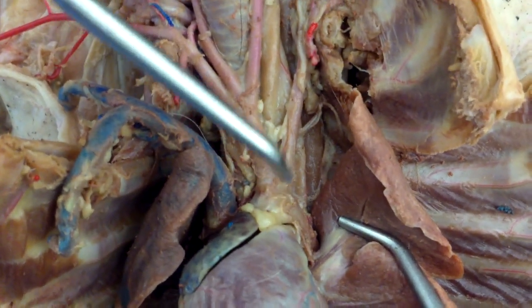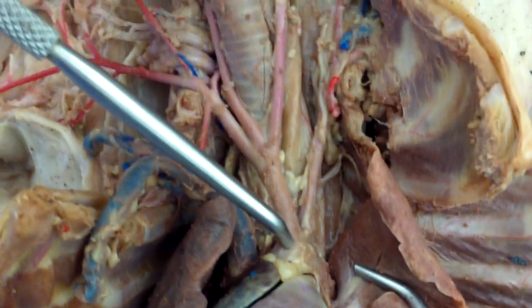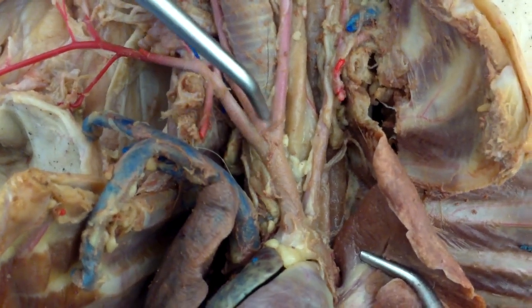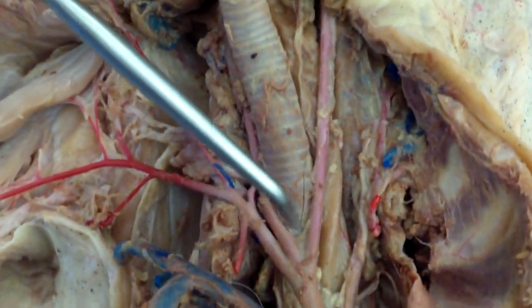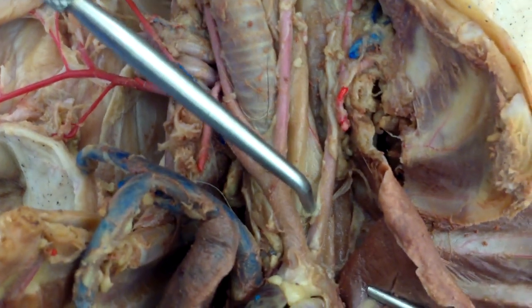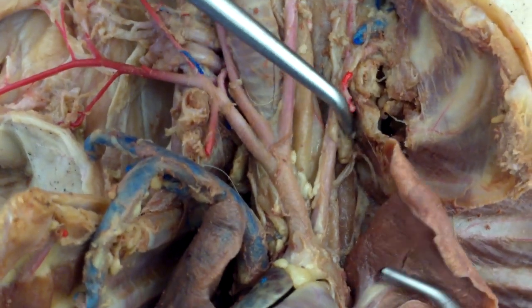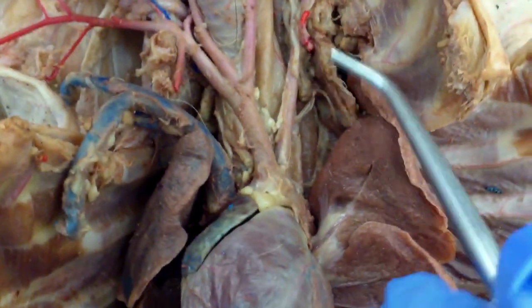In the aortic arch you have the brachiocephalic trunk. And then you have your right and your left common carotid, and your right and your left subclavian.